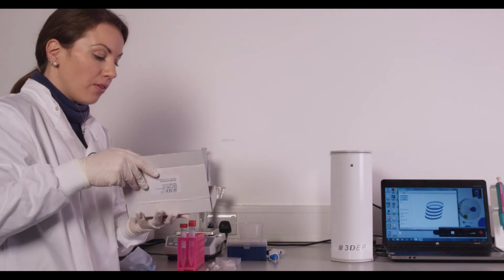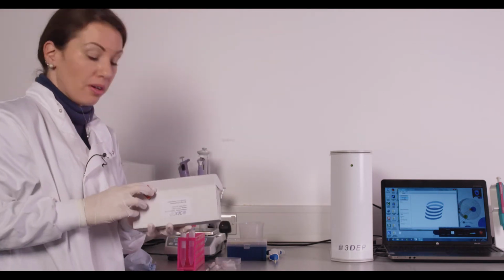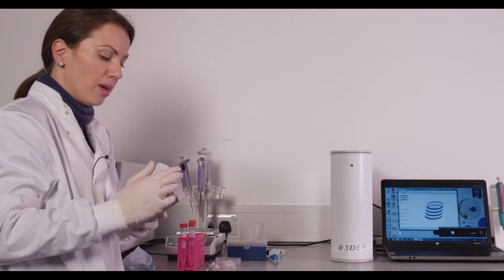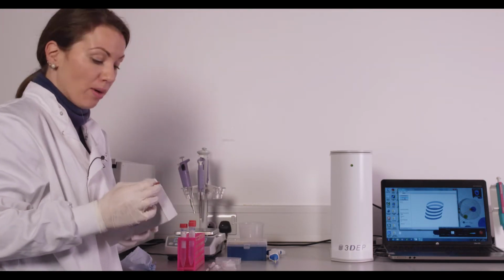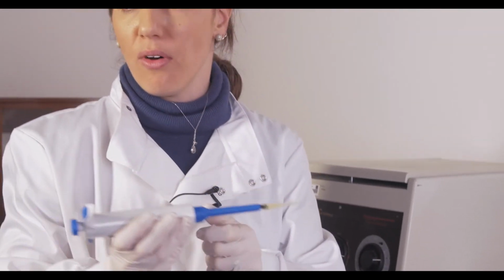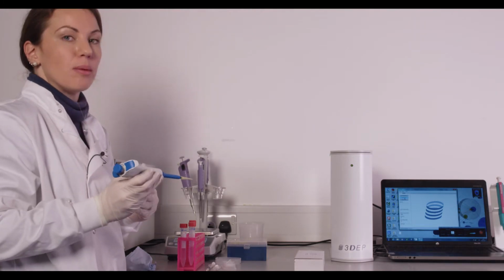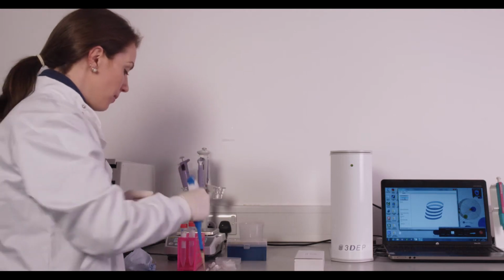For example, if you're very limited on your cell sample, so if you've only got a mil or even less of your cell sample, you'll want to make sure that you keep track of how much volume you're using. With these 1 mil syringes, you can't get a good measure of that, whereas with the pipettes, you can measure out exactly the minimum requirement volume to fill these chips. Depending on your cell type, that's somewhere between 75 microliters and 85 microliters.